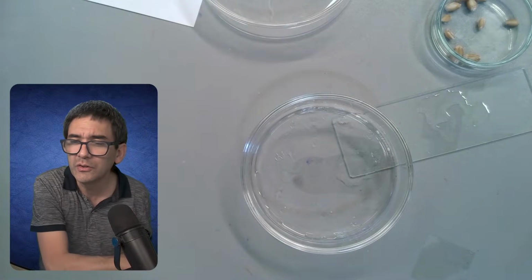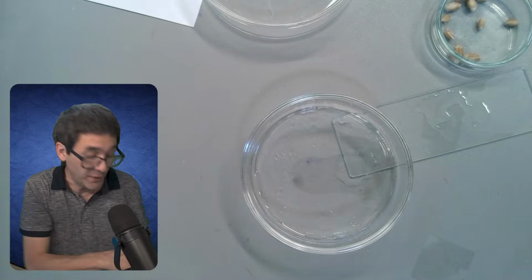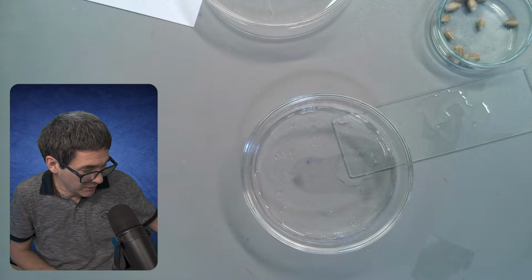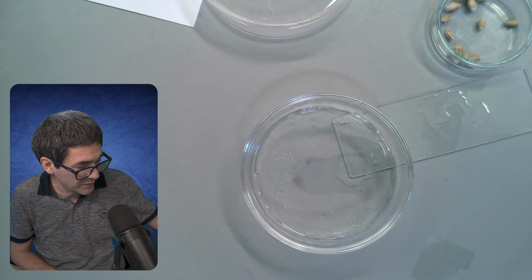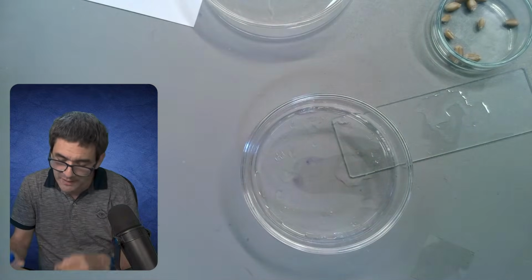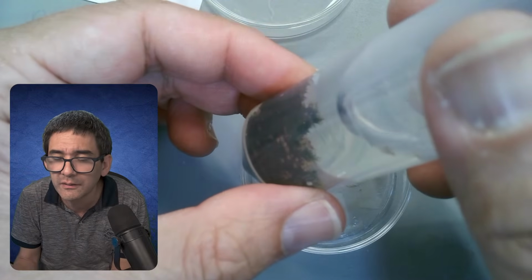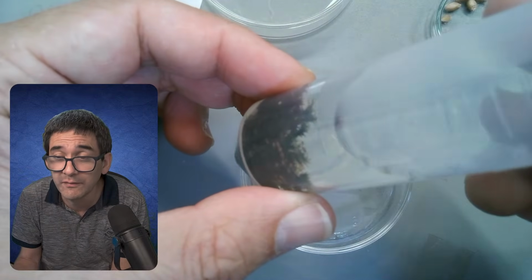Composite eyes of a housefly. Another thing that I would like to do, and over here you have also the slightly larger sample. You can see that there are... what do I give them to eat?